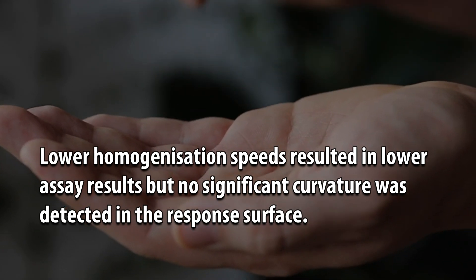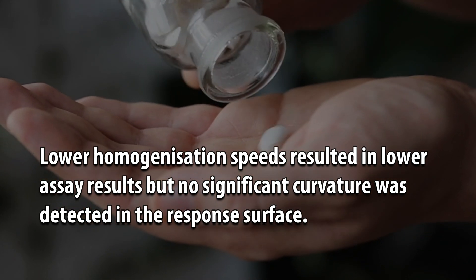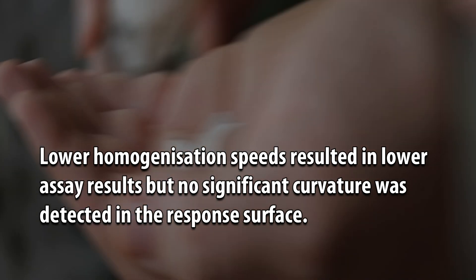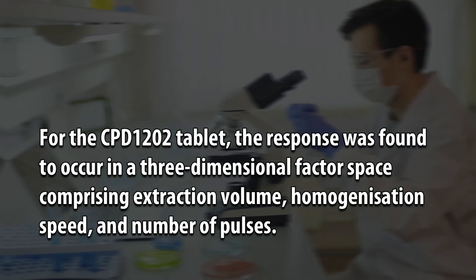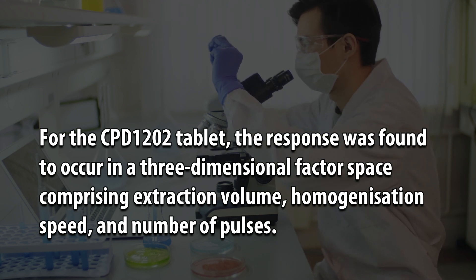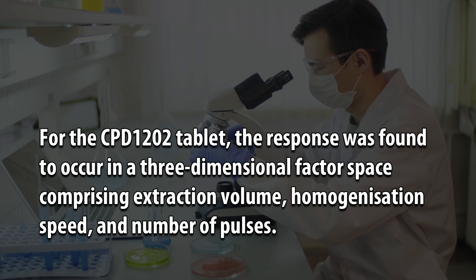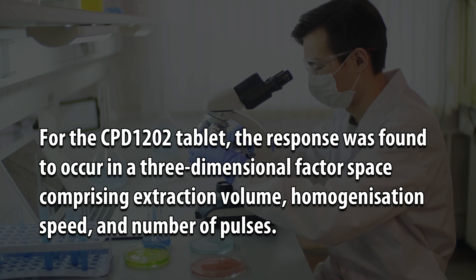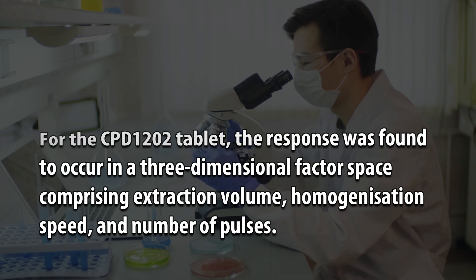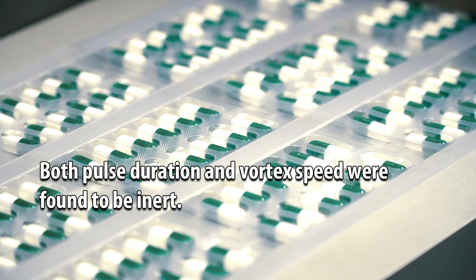Lower homogenization speeds resulted in lower assay results, but no significant curvature was detected in the response surface. For the CPD-1202 tablet, the response was found to occur in a three-dimensional factor space comprising extraction volume, homogenization speed, and number of pulses. Both pulse duration and vortex speed were found to be inert.